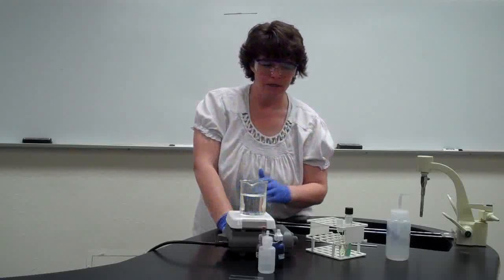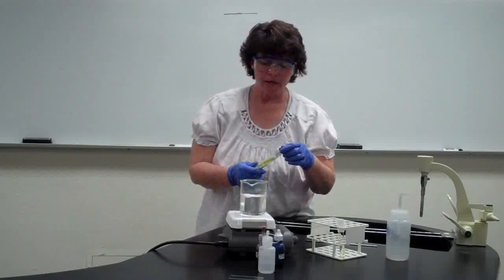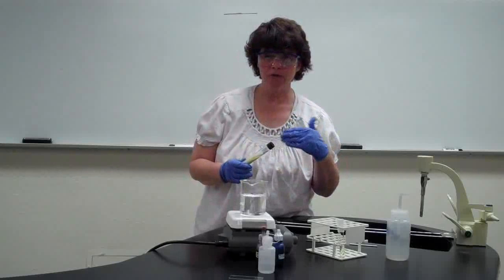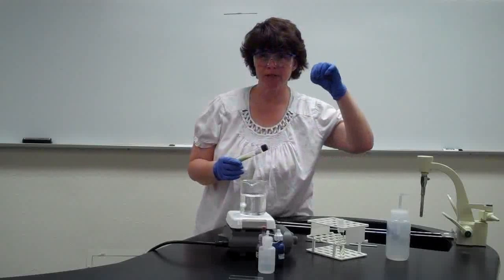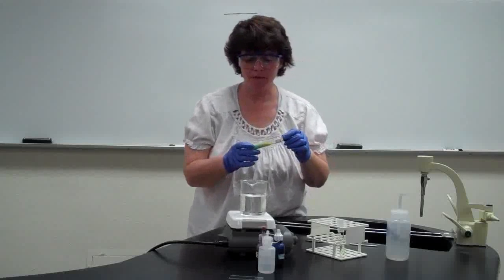So one of the things that I also want to point out is the type of bacteria that we're going to have. The Mycobacterium, because of that waxy coat, the bacteria really stick to each other. So when you go to make a smear, you may have a problem kind of breaking the cells up instead of getting a big chunk of them, and we've had some issues with other bacteria with that happening.